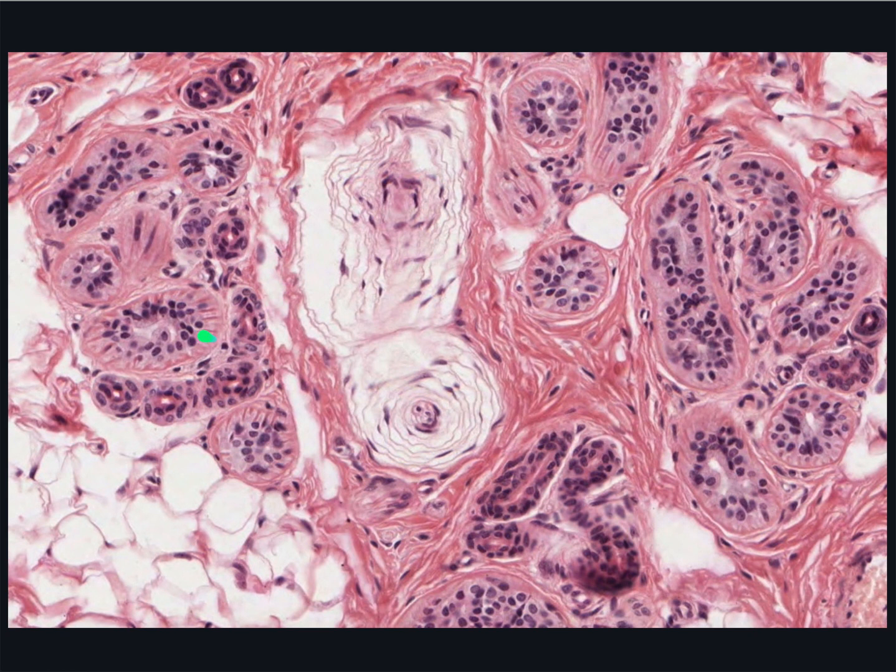Look very carefully. They have the shapes of multi-armed starfish with their arms orientated along the tubular gland. So in cross-section, their arms are visible as red wedges at the outer edge of the gland. They're strongly eosinophilic due to having an abundance of actin and myosin in their cytoplasm. Longitudinal or oblique sections show that the arms are actually elongated. Myoepithelial cells, like the secretory cells, are ectodermal in origin and are part of the epithelium of the sweat gland.